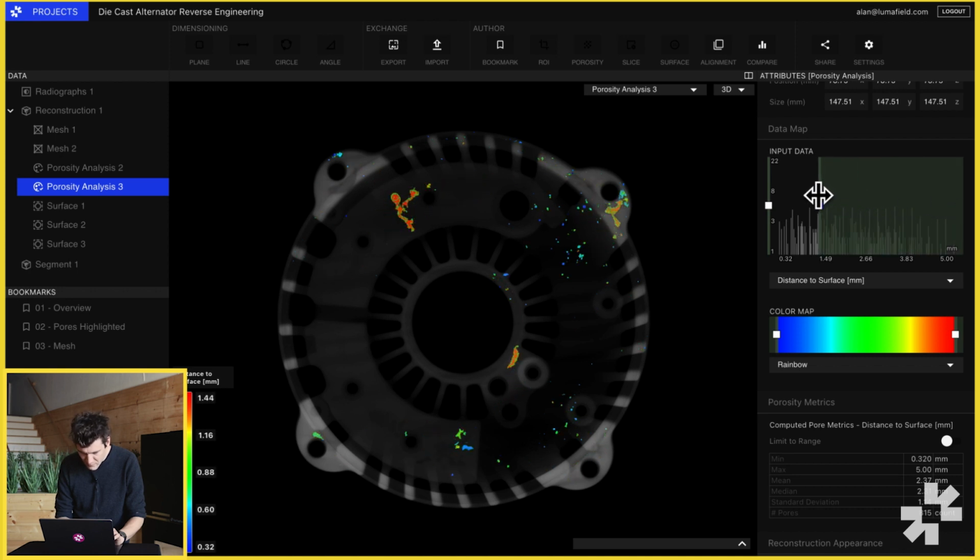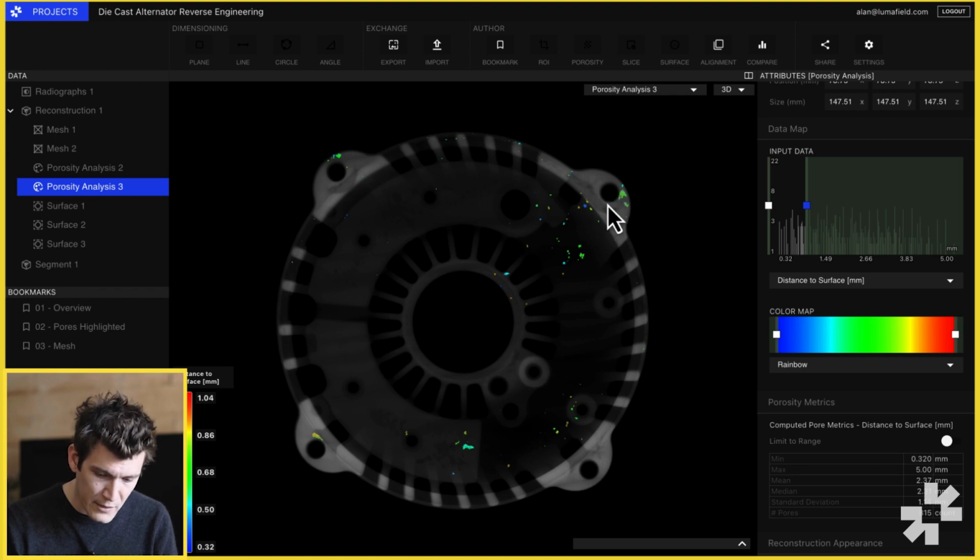And as we threshold down, we can start to see our pores that are close to the surface, including this one, which is just below the surface of this bolt hole. So if we're going to be post-machining this, drilling this out very well might open up that pore.